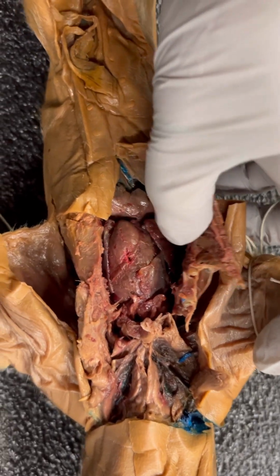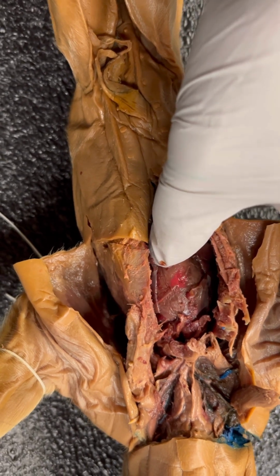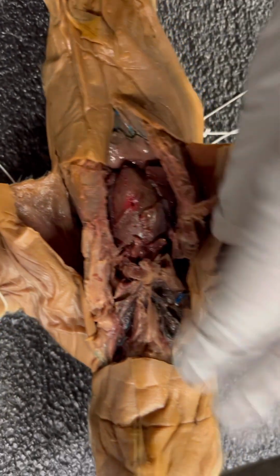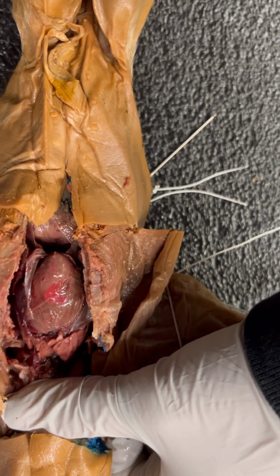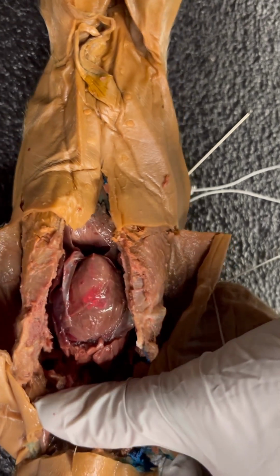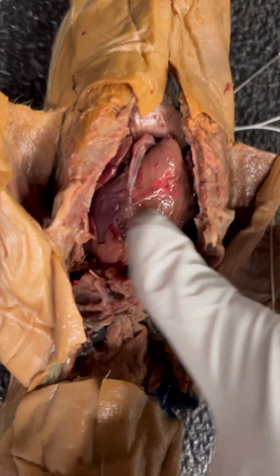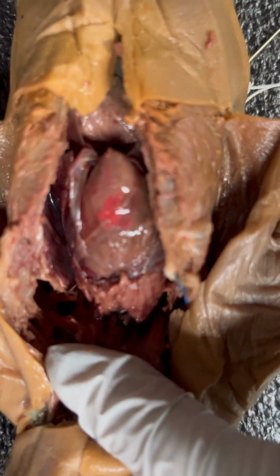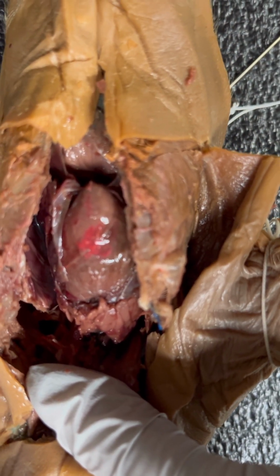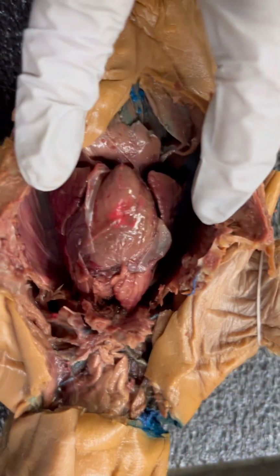You can see the lungs here, not that we're talking about that right now, and this is the heart. You can also see where I punctured the heart by going in too deep. I will have to hold this like this so you can actually see what I need to show you. The pulmonary arteries are over here, and then underneath this, it's so dark, it's hard to see, but right there is going to be the brachiocephalic trunk. That's going to be right in the center. You can see the whole aorta, you can see the lungs here.